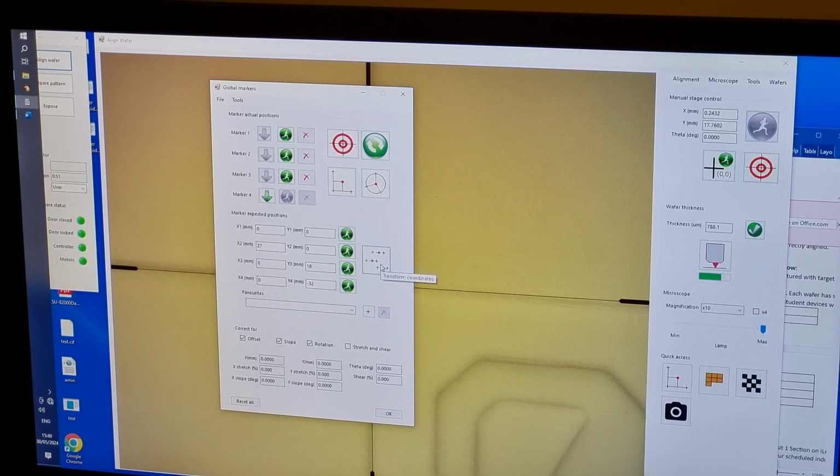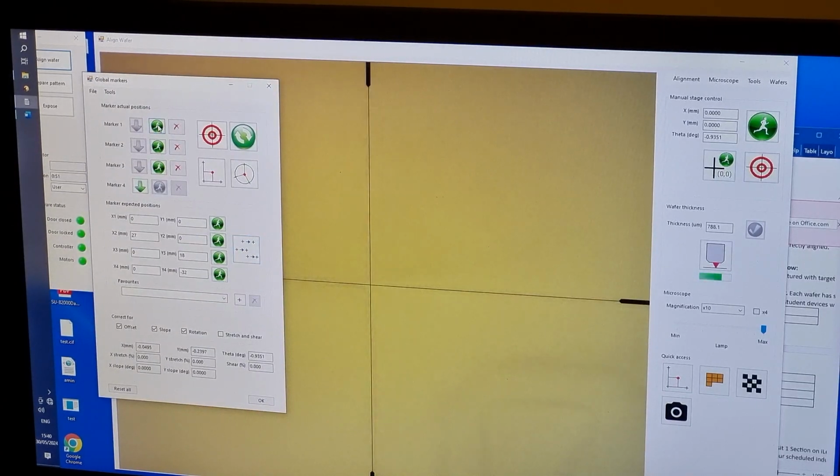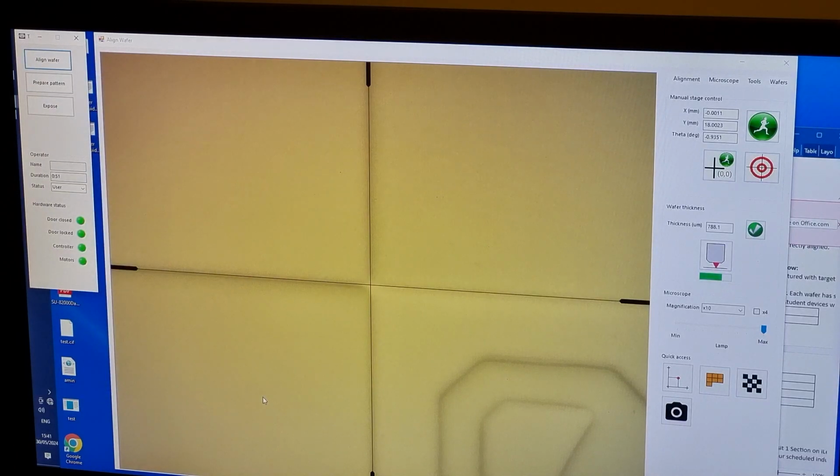With 3 alignment marks, we can offset and rotate the data to fit the wafer pattern, but also compensate for a sloped Z-plane. The button to the right of expected marker positions transforms real space into wafer space. After clicking this button, Manual Stage Control coordinates should match wafer space coordinates. We check this by going to each mark and seeing that its location matches the expected coordinates.